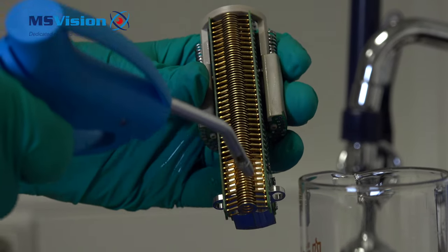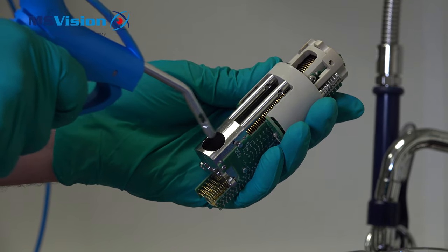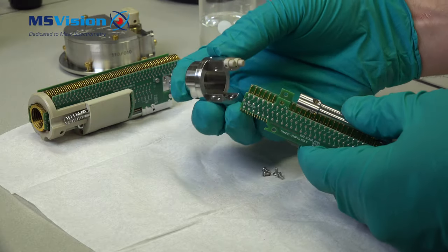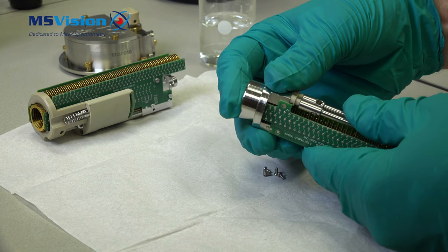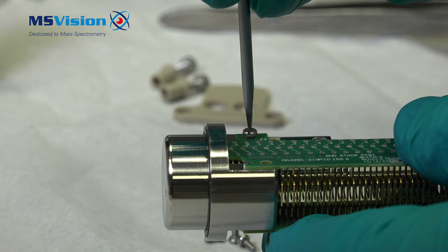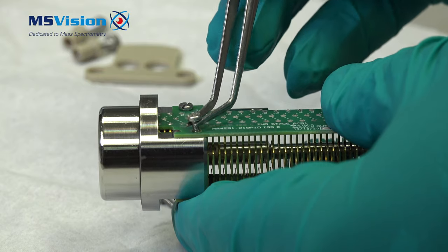Be very thorough, paying attention to dry each ring and all of the hard to reach places. Refit the top hat, but be careful that you don't push with your finger on the hole because it is a sensitive part. Then carefully fit the screws again as they are quite tiny and with gloves it's always difficult.